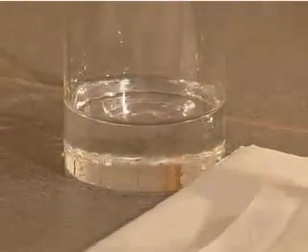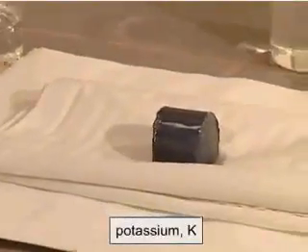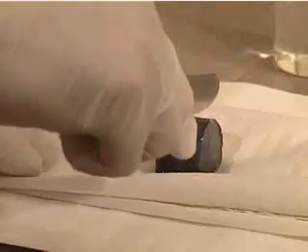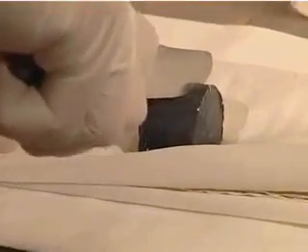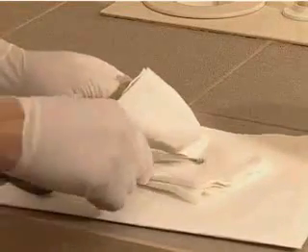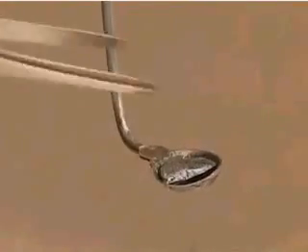We will do the following experiment to obtain potassium superoxide. We place a little piece of potassium on a small aluminium tray and place it in the burner flame.